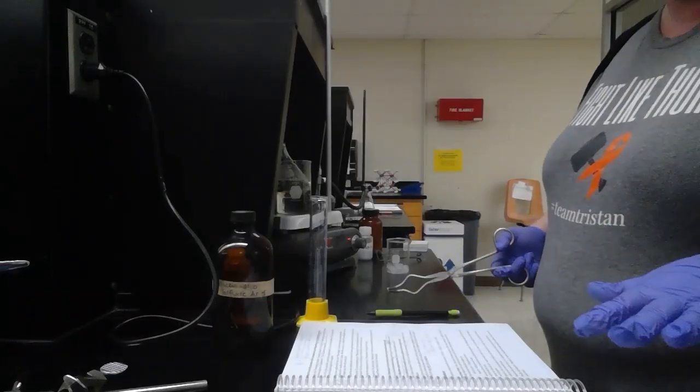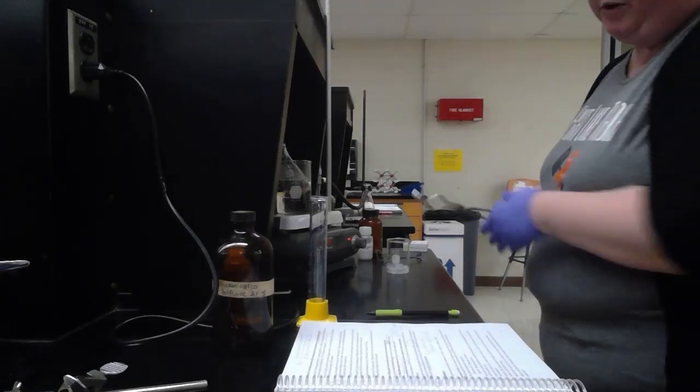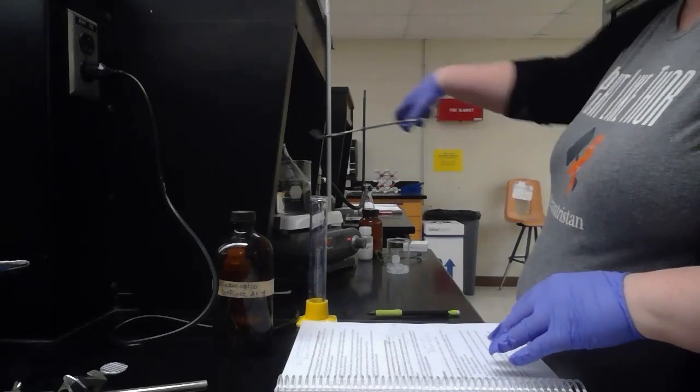Now that the 15 to 20 minutes has passed, I'm going to remove my Erlenmeyer flask from the water bath and then add 25 milliliters of cold water and about 10 grams of ice.